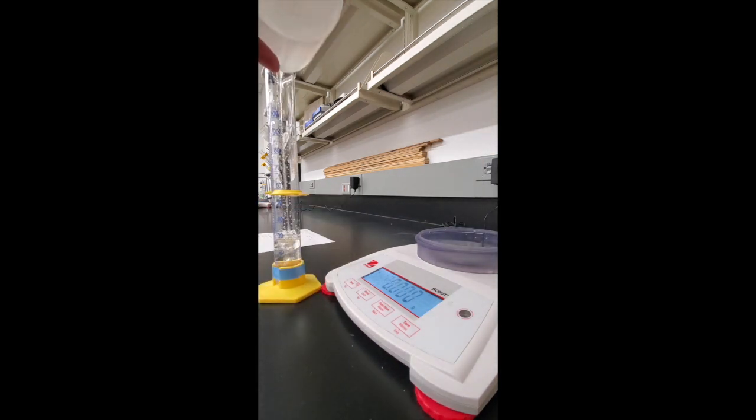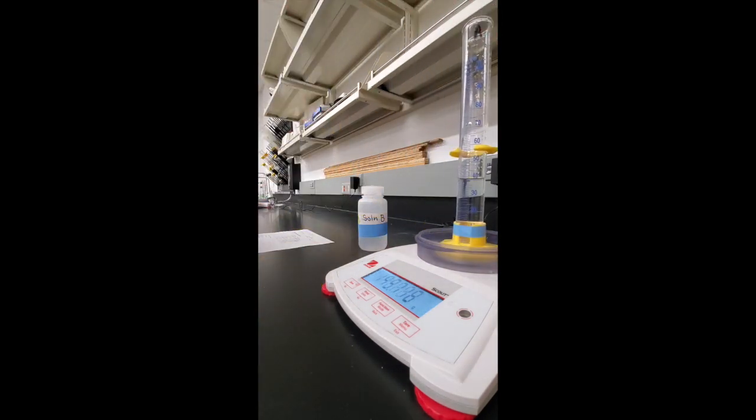More of solution B is added. The volume is 40.8 milliliters and the mass is 149.244 grams.